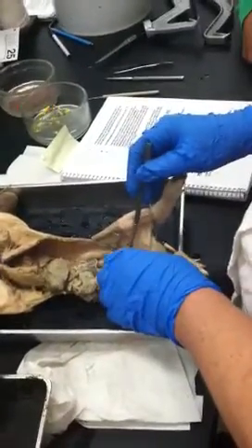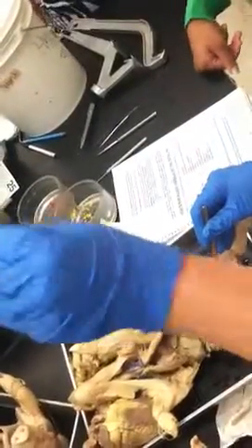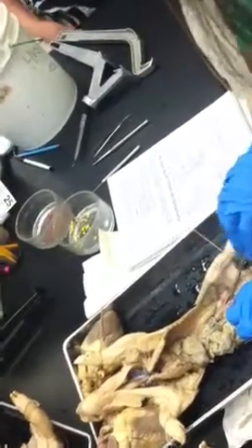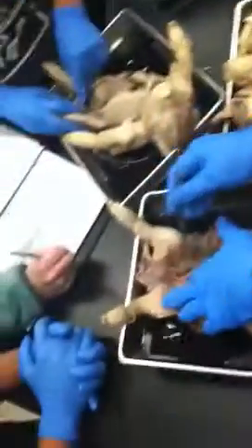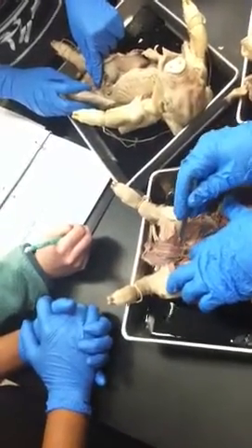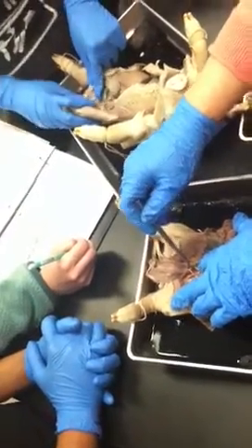So from there up it's the umbilical artery, but the internal iliac is right near that stem, and it heads into and it breaks off. So this is the internal iliac, this little guy right there. Down here it's external, iliolumbar, external again, should be femoral, deep femoral, and then look here. And it should come off of there.